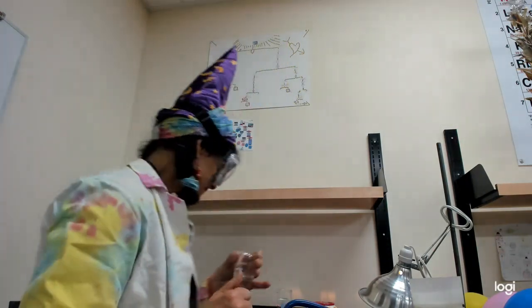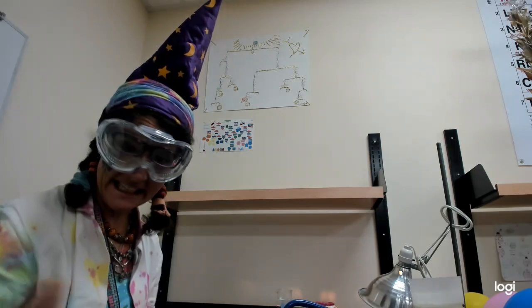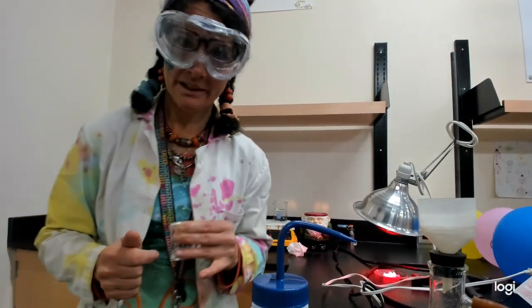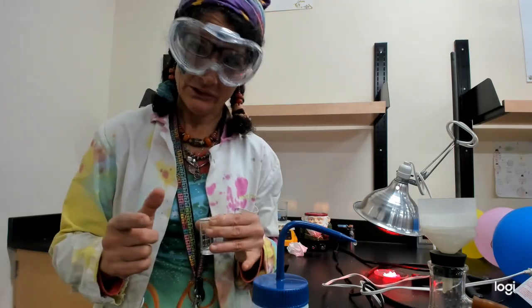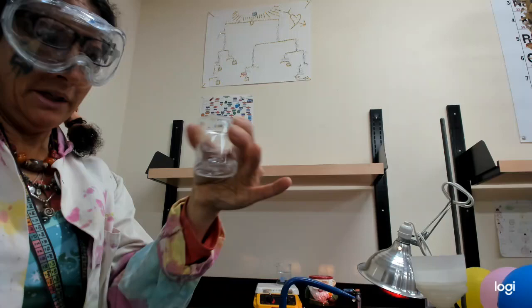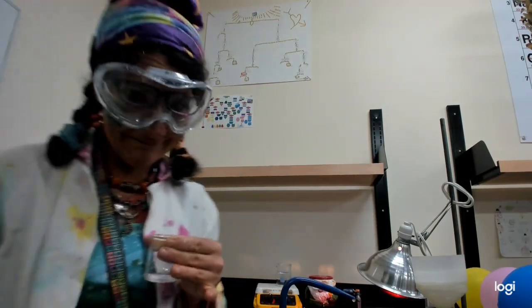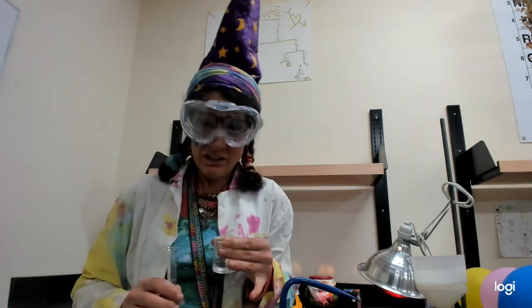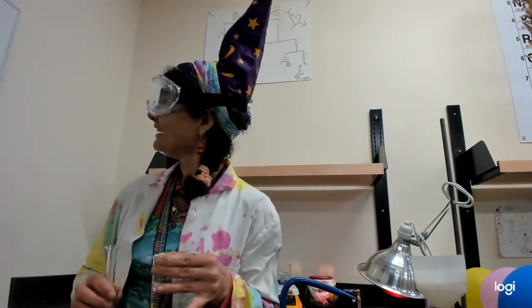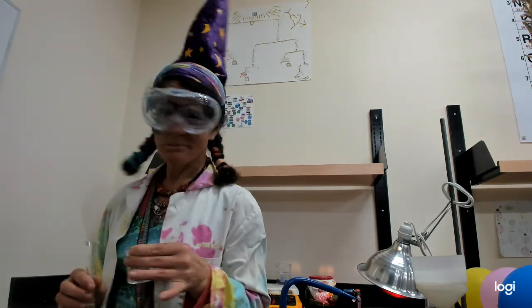Alright. And then, as I started heating it, it started dissolving. So, I got out the heat lamp. We're going to do it that way. Might be a little safer. Alright. Then I took my wee sample and I dissolved it in ethanol, because again, it's not water soluble. Just too many carbons. Oxygens. Yeah, there's a lot of oxygens too. It just doesn't like water.